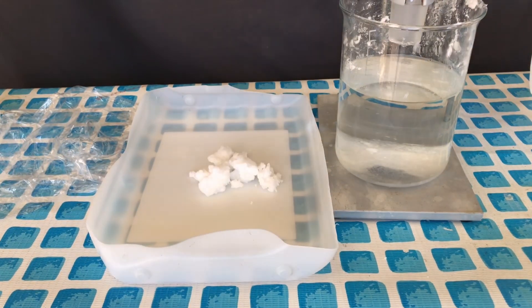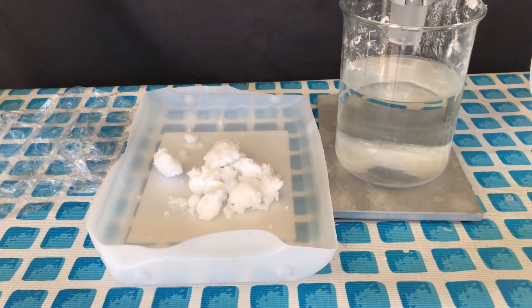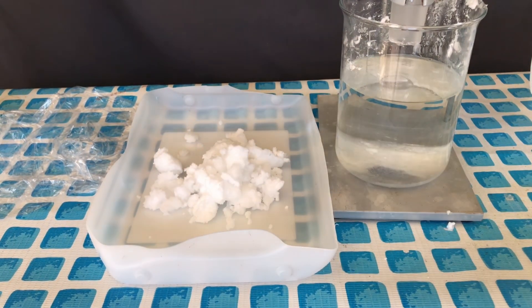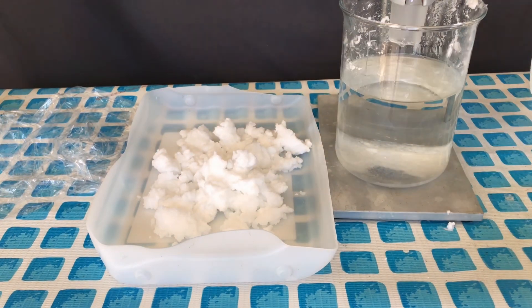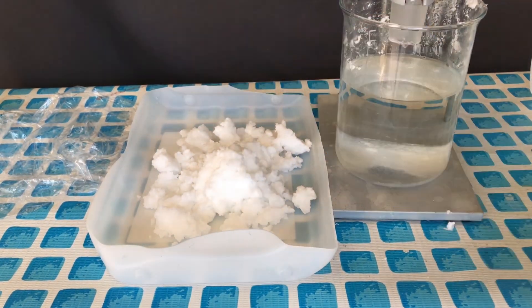The pure stuff on the other hand was scraped out into a drying dish and put into the sun until it had completely dried. The high content of isopropanol in the liquid left in there should make drying a lot faster than if it were just water.